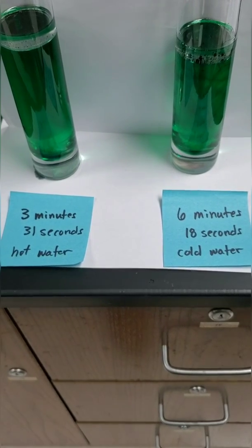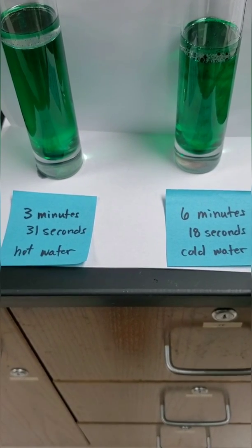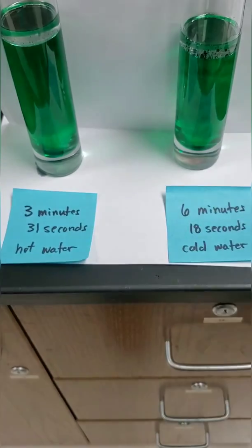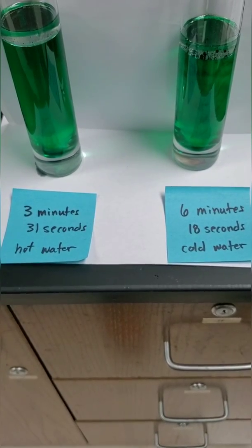So here's the end of the experiment. We have a few left to pop, but for lab book purposes, six minutes, 18 seconds on cold water. And a long time ago, hot water finished at three minutes, 31 seconds.